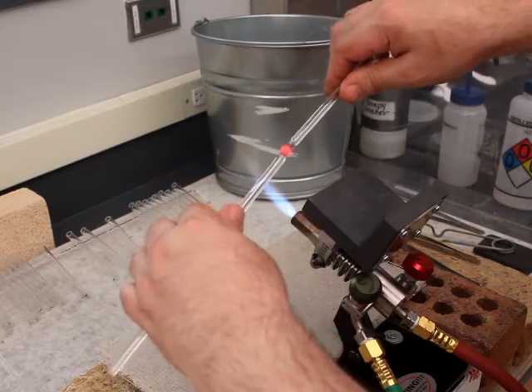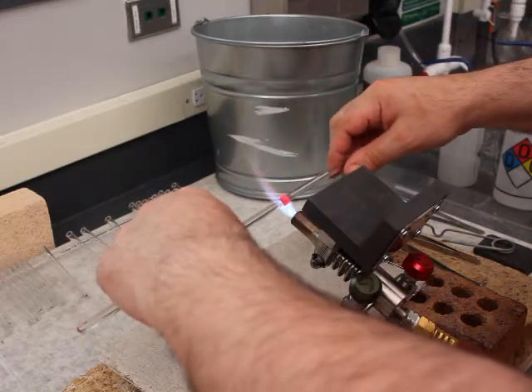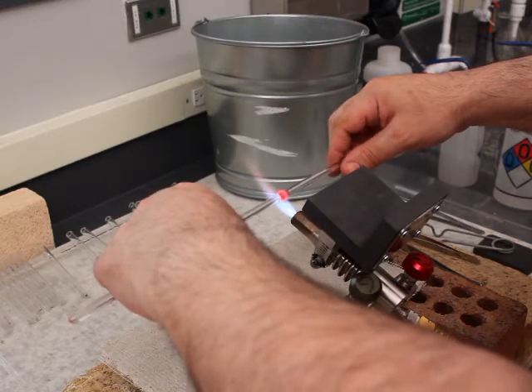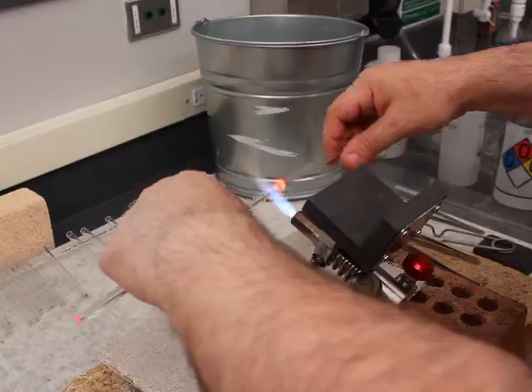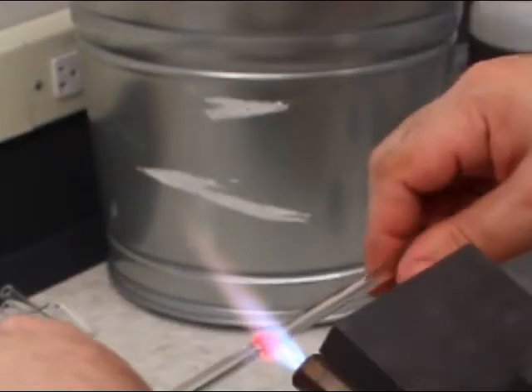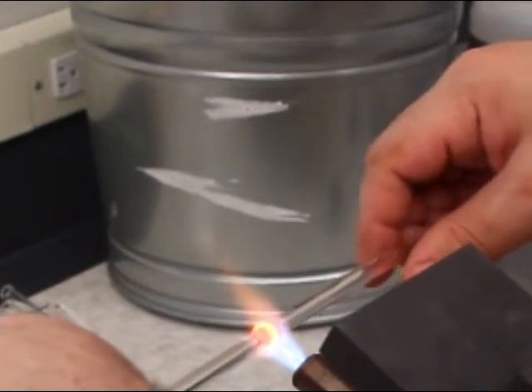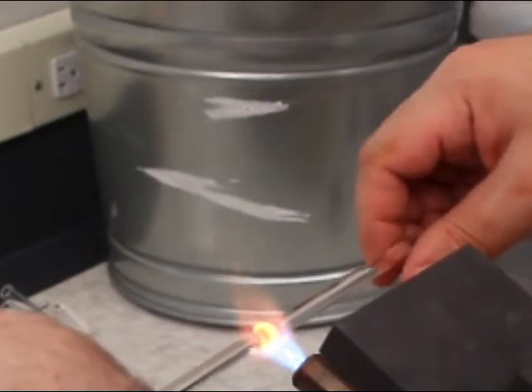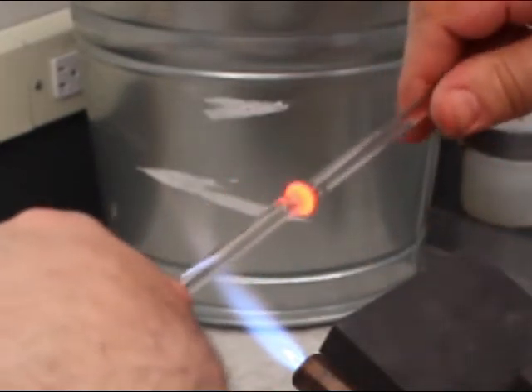So with the Maria, you heat that section of glass up, again, as you are rotating, and then I come out of the flame and I gently push while rotating to make the Maria, make that disc. This particular glass, because I used those scraps, was a little lumpy and bumpy on the edges, but overall, it's more me than the glass as far as the non-uniformity of the Maria.